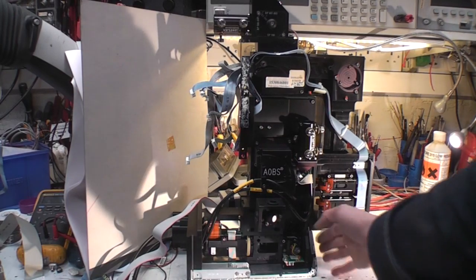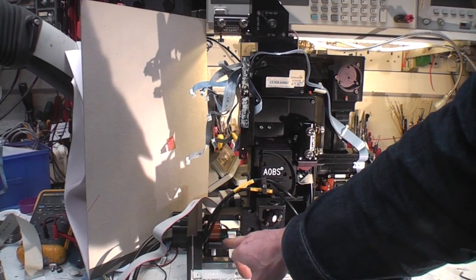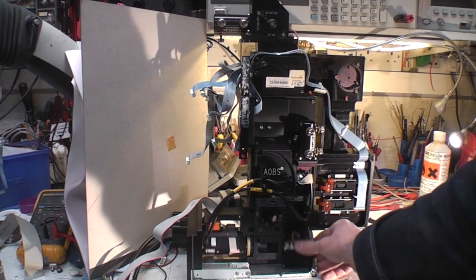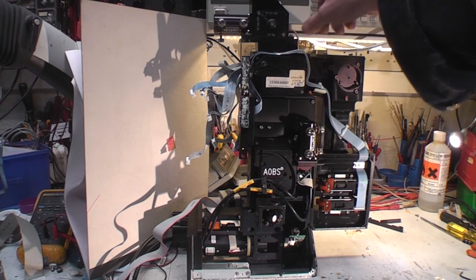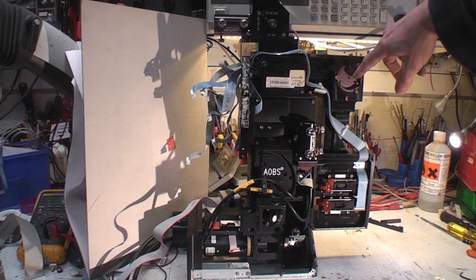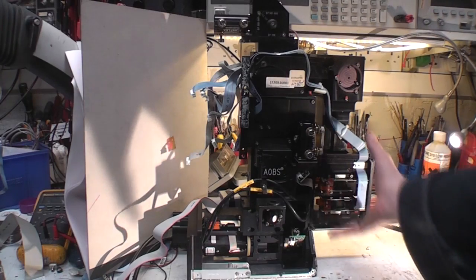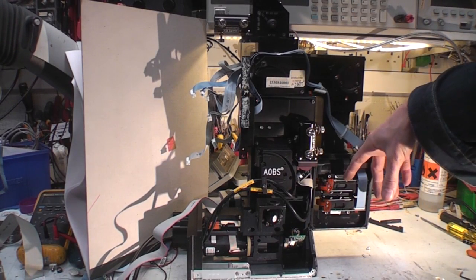There's the main exit port, looks like it's down on the right here, so there's probably down here this scanner. We know there's a galvanometer on this section, this whole sort of rotating section. Then it sort of goes back through the beam splitter up to, this is the additional port for potential other lasers. This will be the prism, I think. Then it goes down to these motorized slits, and then the detector assemblies. There's one here and then one on the back for the photomultiplier detectors.